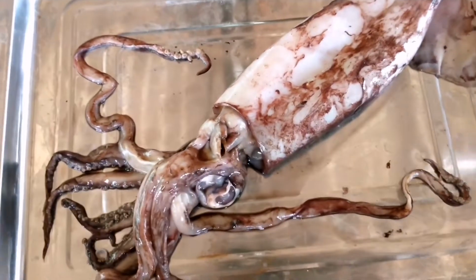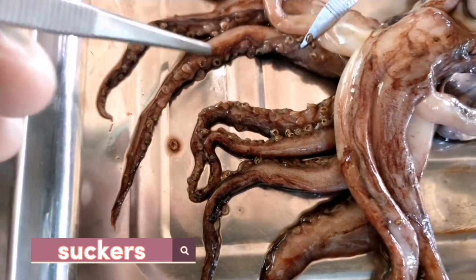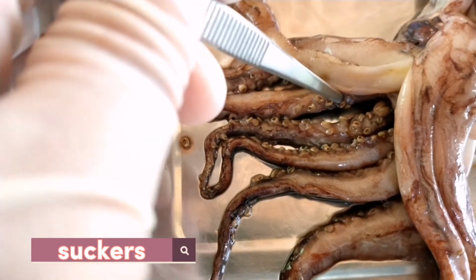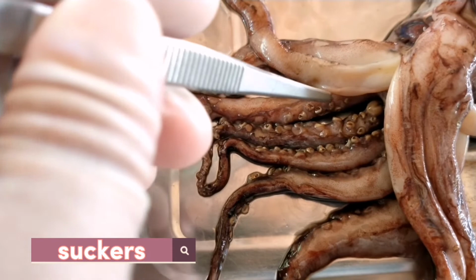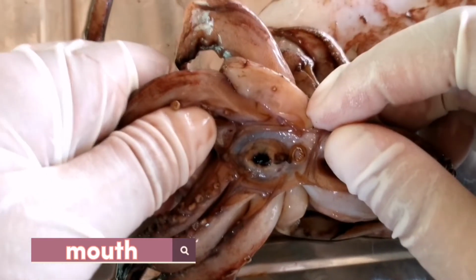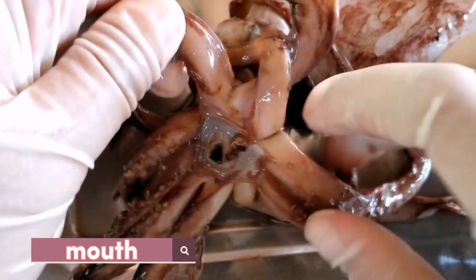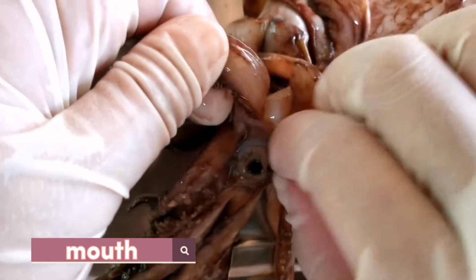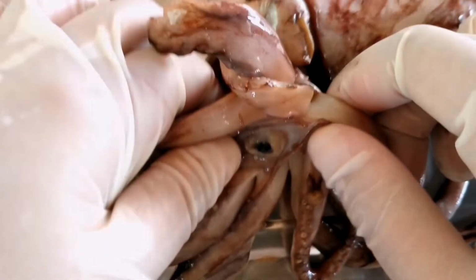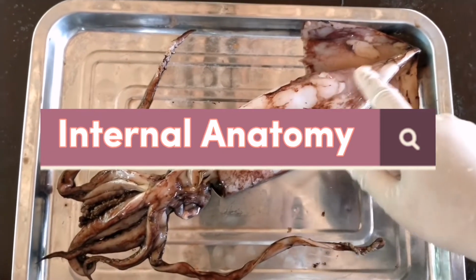The arms and tentacles are covered in these suckers, which provide suction to grip prey. The tentacles usually grab and reel the prey in, while the rest of the arms hold and move around the prey while the squid eats. And this is the mouth of the squid located at the center. The squid's mouth has a structure inside called the beak, which is used to cut up its prey. And now, let's take a look at the internal anatomy of the squid.